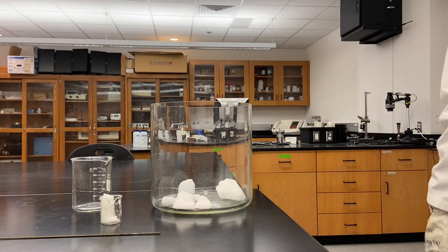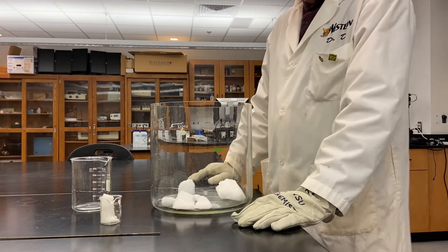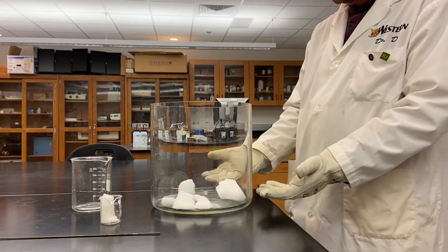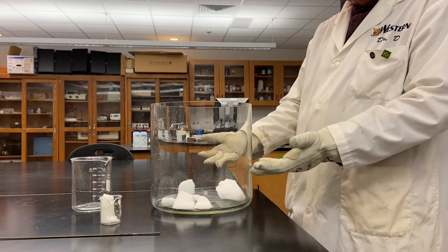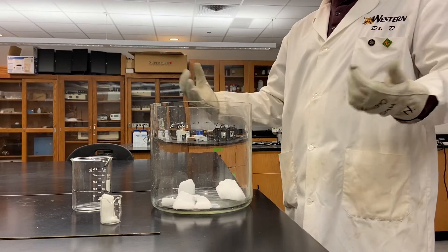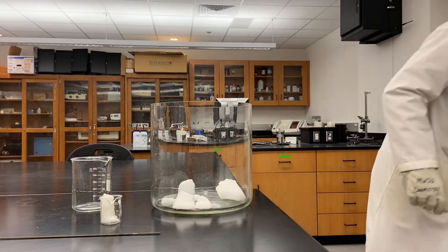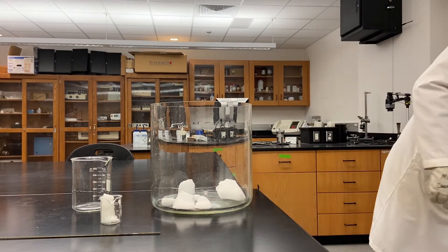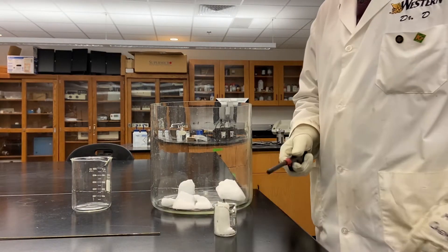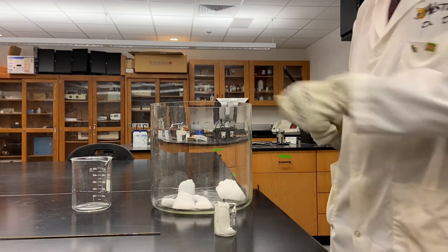Gas phase carbon dioxide is a very dense gas, and so the consequence of that is that my container is filling from the bottom up, pushing the air that used to be inside the container out. To help demonstrate that, I'm going to place a candle down into this container.